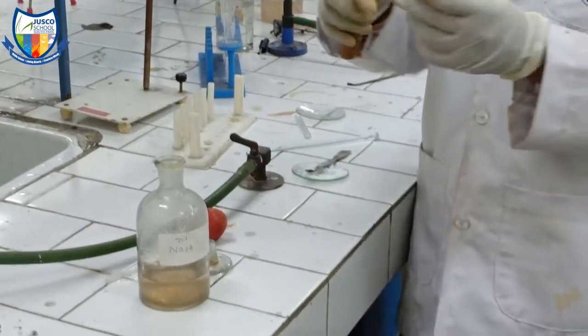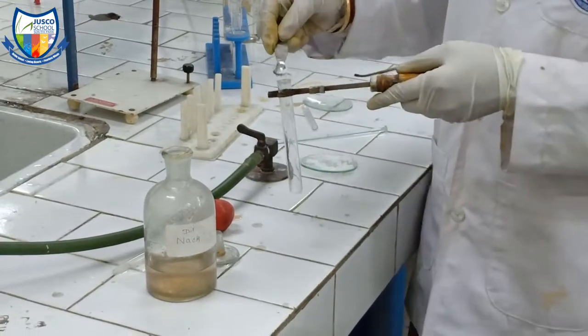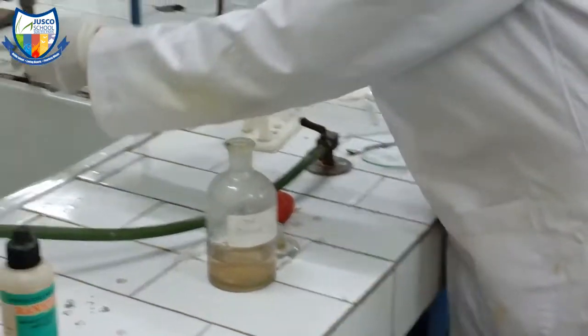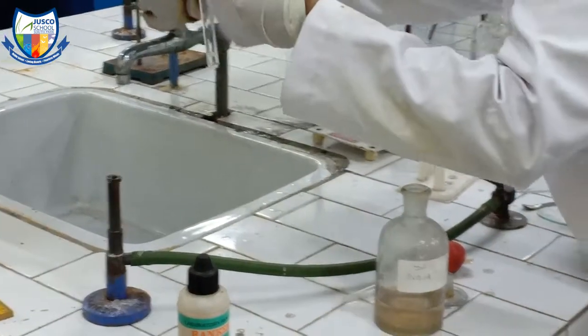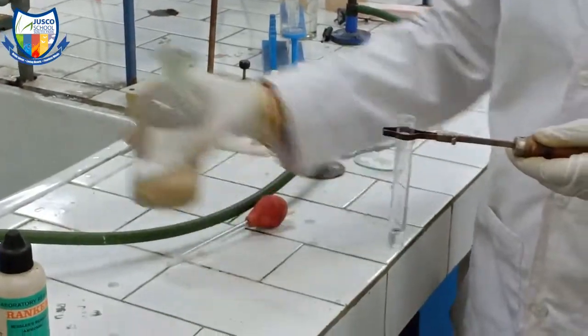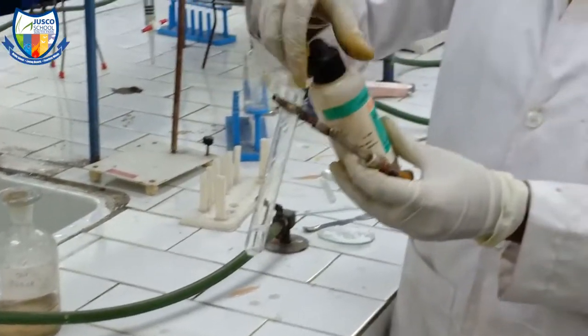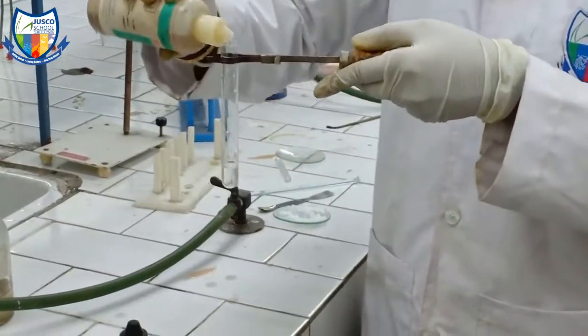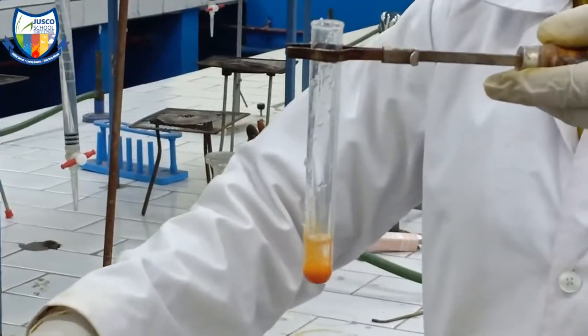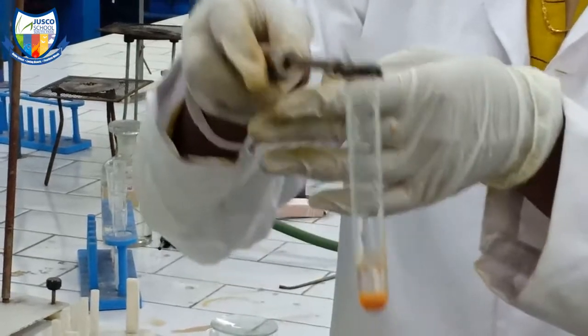We take another clean test tube, put some salt in it, and add a little water so the salt dissolves. Now that the salt solution is prepared, we add a few drops of Nessler reagent. As soon as only one drop of Nessler reagent is added, the colour changes completely to brown, and small particles settle at the bottom as a precipitate. This is the confirmation of ammonium.